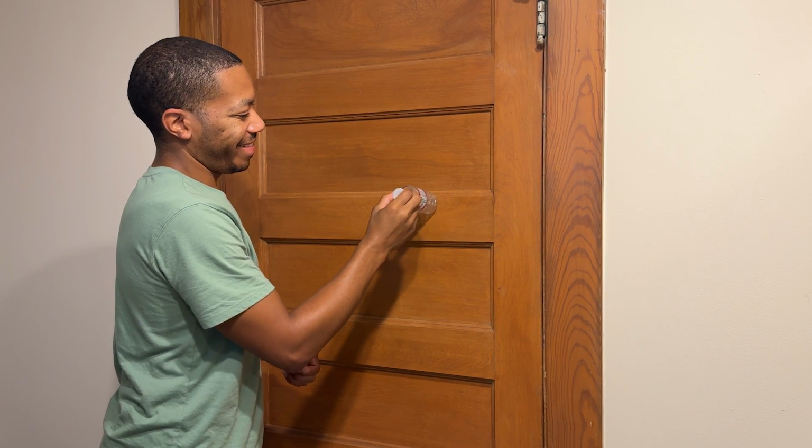And I actually do have a water bottle that I will test in this video and demonstrate where that will land on our scores plot, as well as my door and a Pyrex container, all for different points of reference in this model. When it comes to building a data model, you need to pre-process this data, and Python has several techniques to allow me to pre-process my spectroscopy data.